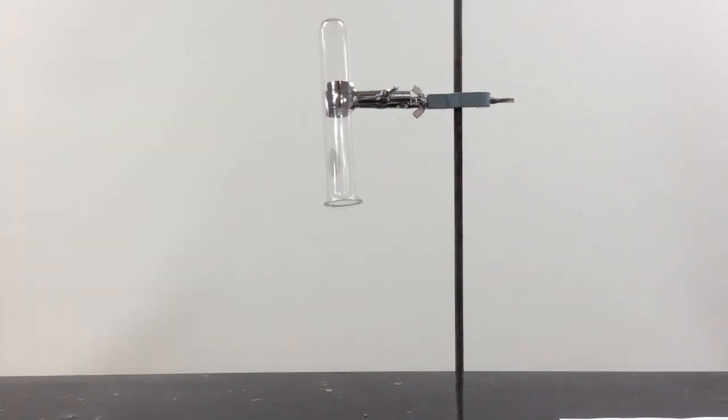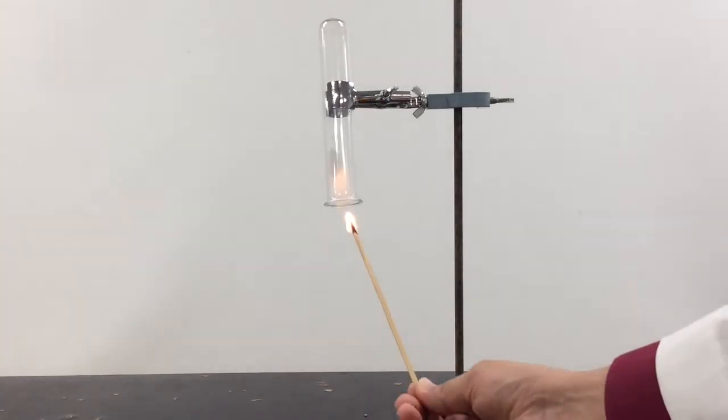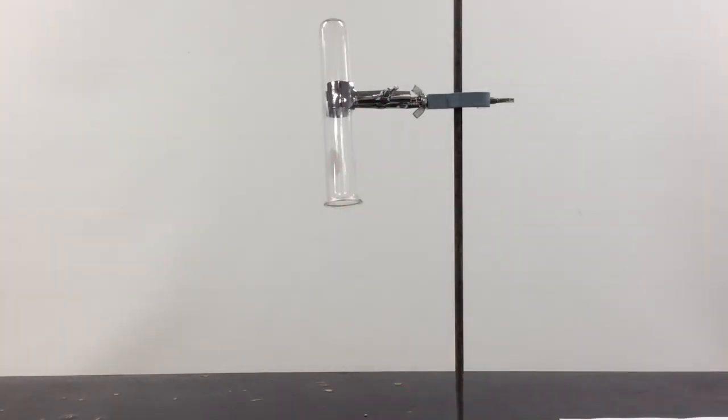Let's see what happens when I take this little flame and set the hydrogen on fire. Did you hear the pop?